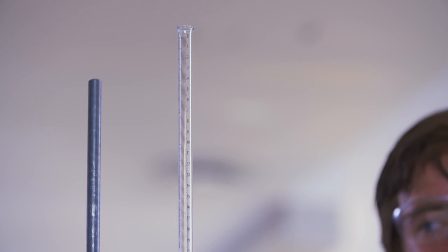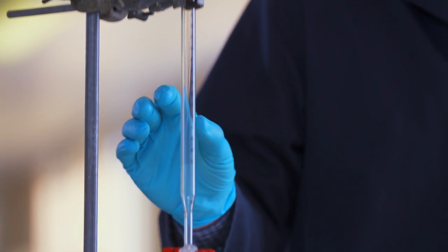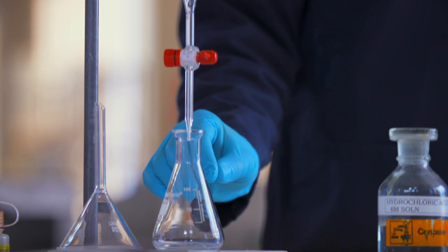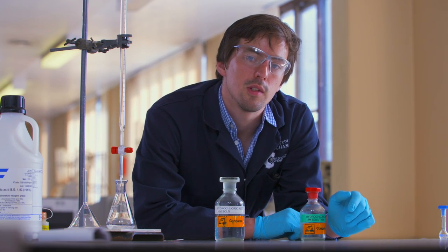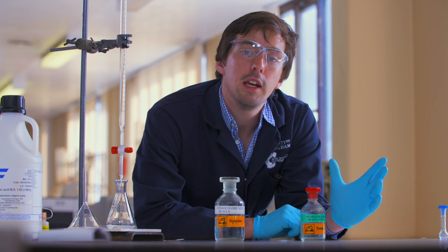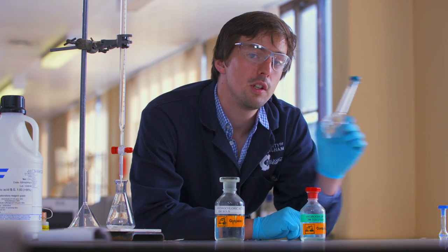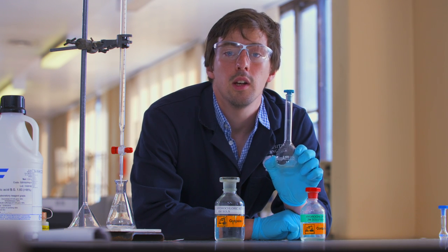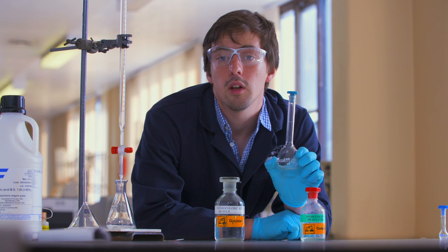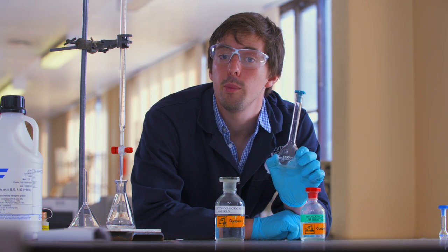The best way to achieve this is to use a titration. We can use a burette to add a very specific amount of one solution to another. If we don't know the concentration of one of our solutions, we can make a standard solution with a well-known concentration using a volumetric flask. We can then titrate our standard solution against the unknown solution until we get a perfectly neutral green colour on the pH scale.